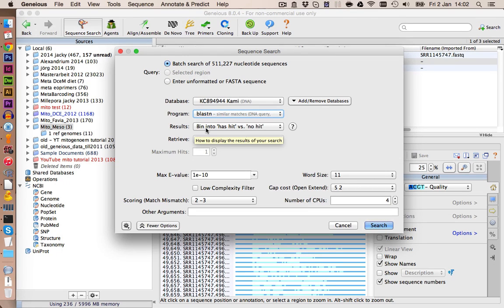Then we want to export the hits into hits versus no hits, so it makes us 2 files, all the queries which were matched to the reference genome and all the queries which were not matched against the reference genome. This way we can use basically our reference genome as a template, map all the reads against it, and then we have our first draft genome for our organism.